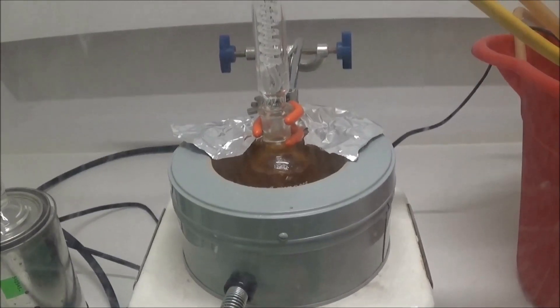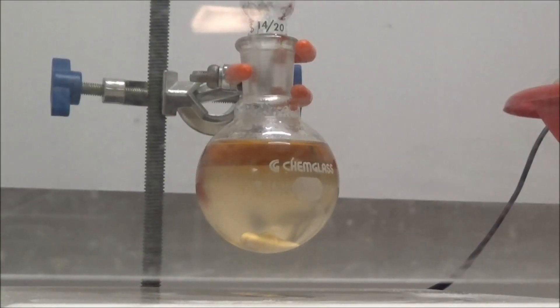Once the 3 hours was up, I turned off heating and let the flask cool to room temperature. You can see that two layers formed, the upper layer being our product.